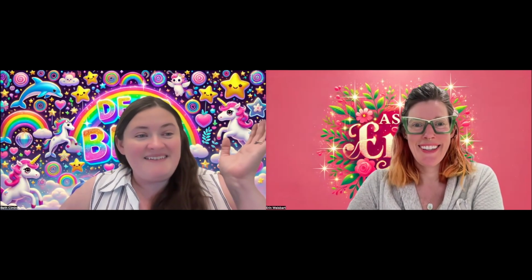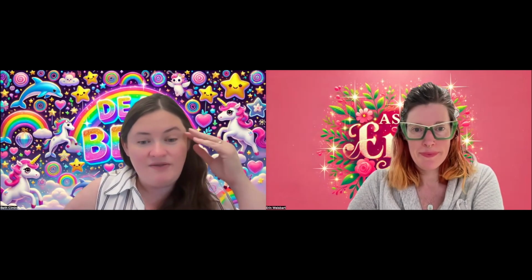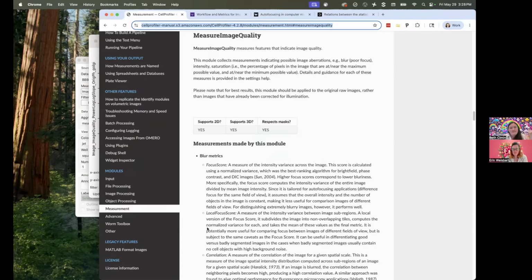Nice. That's a great question because what features mean in general can be really difficult, but it can be especially difficult for some of these things like image quality, and some of them get a little mathy. So when in doubt, I always start with going to the Cell Profiler manual. This is the same exact information that's in the Cell Profiler module help. If you pull up the Cell Profiler module help, you will find all this same exact text. It's actually built from the same exact thing.